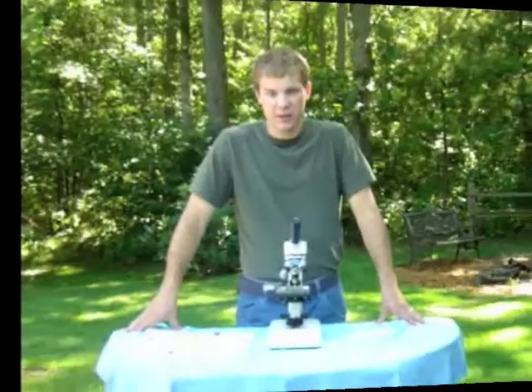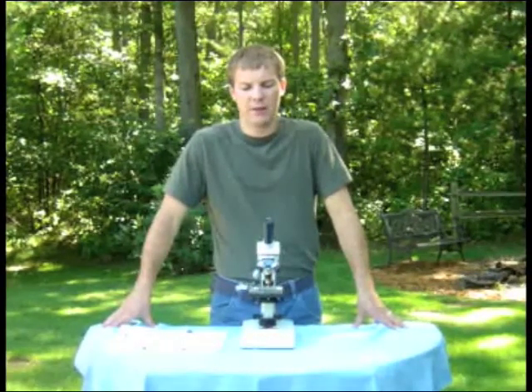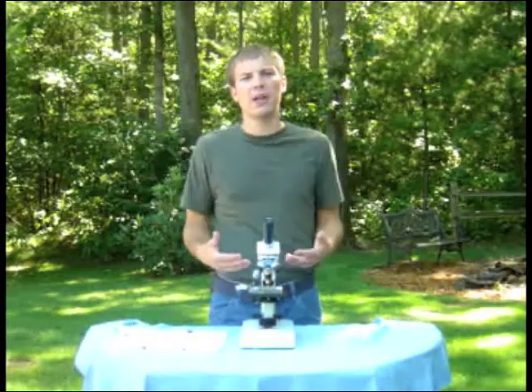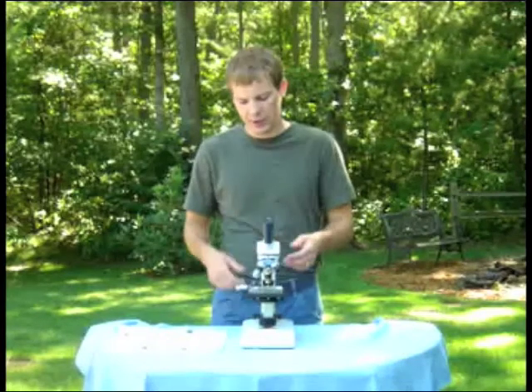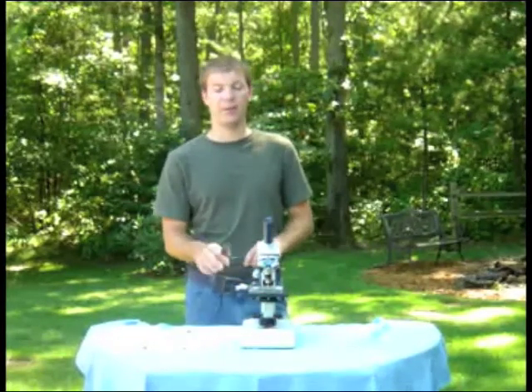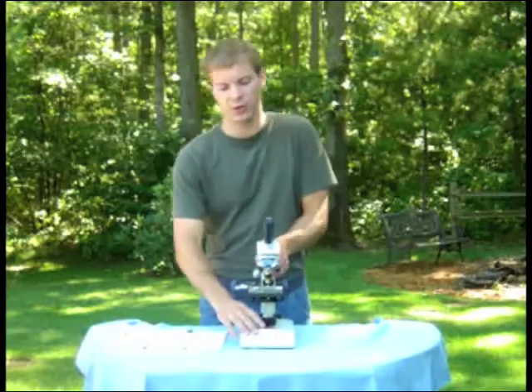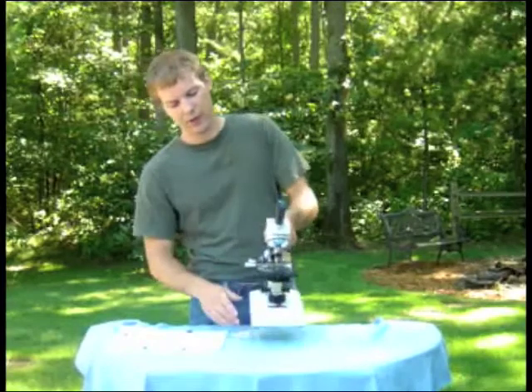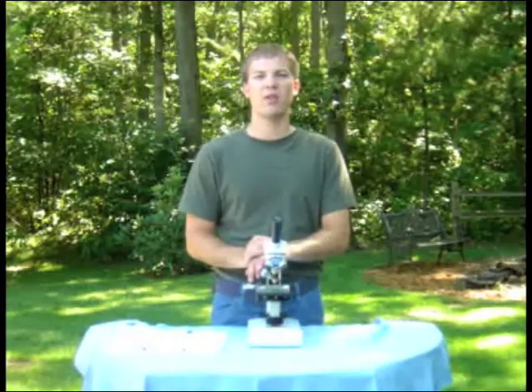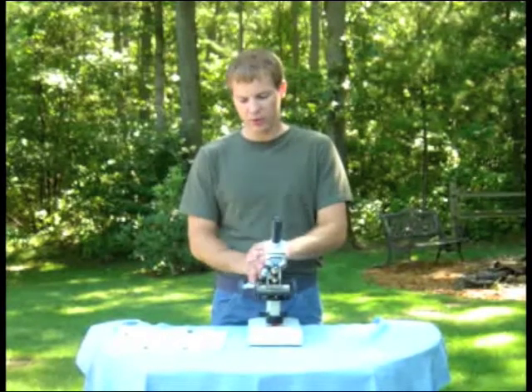Now that we know the parts of the microscope, the things we can adjust, and the total magnification, let's talk about how to actually use your microscope. When you get your microscope in class, the first thing — and I don't mean to be condescending — but first thing, plug it in. Second thing, turn the light on. There's a switch right here, on and off. You'd be amazed how many students plug it in and then tell me the light is burnt out, but fail to actually turn the light on. So plug it in and turn the light on.